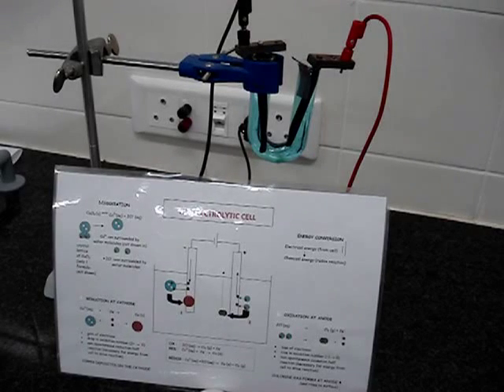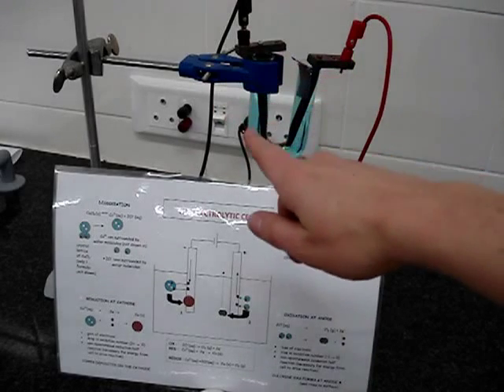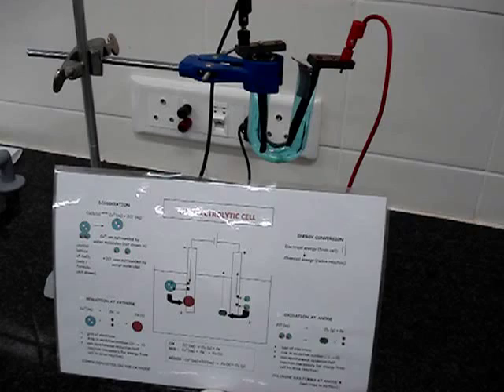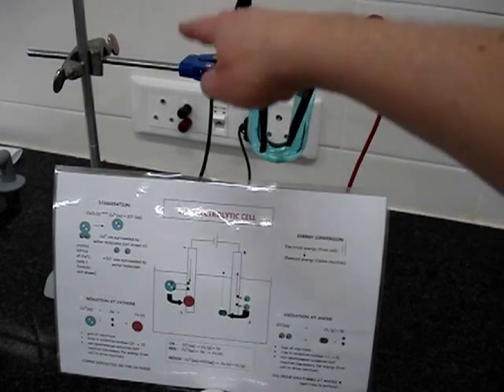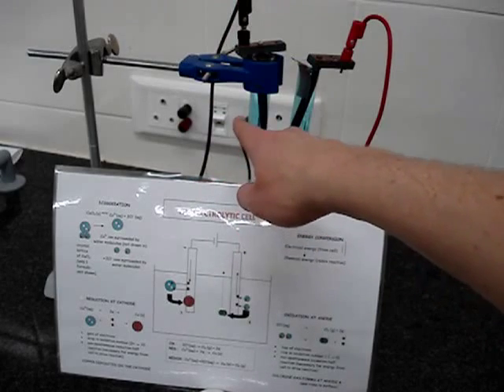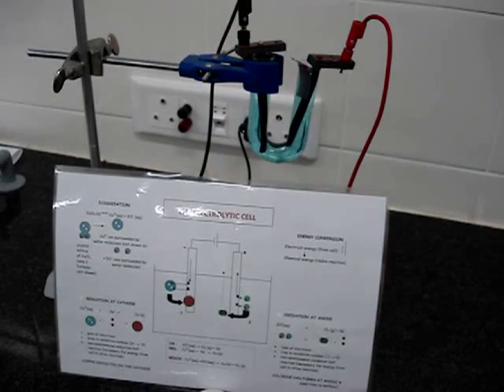This is a copper chloride electrolytic cell. You can see here we have a power source in the background. And we have connected this electrode here to the negative terminal of that power source, that direct current power source.